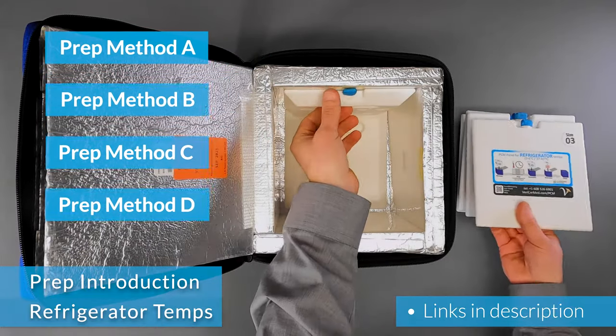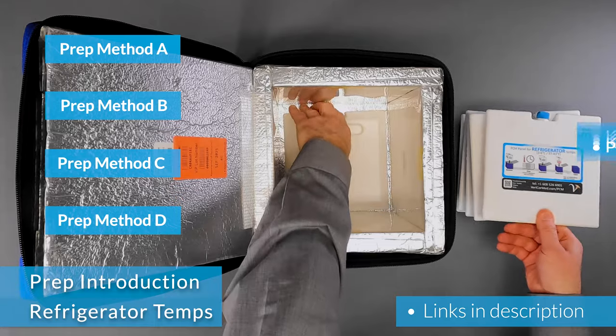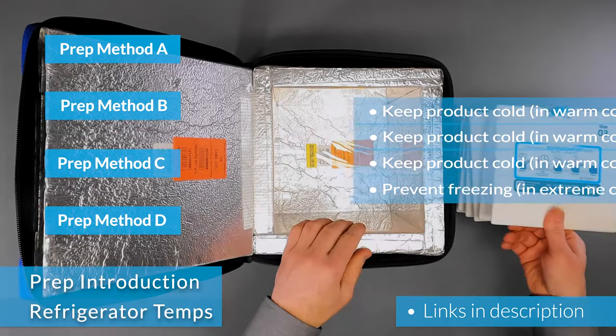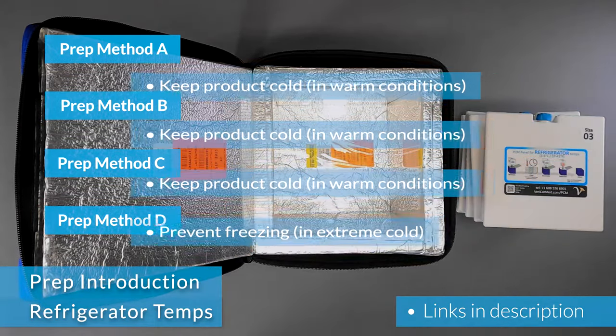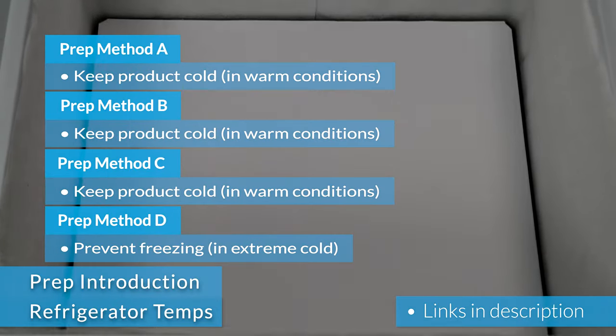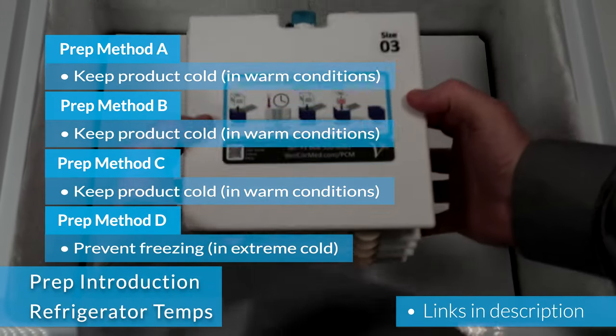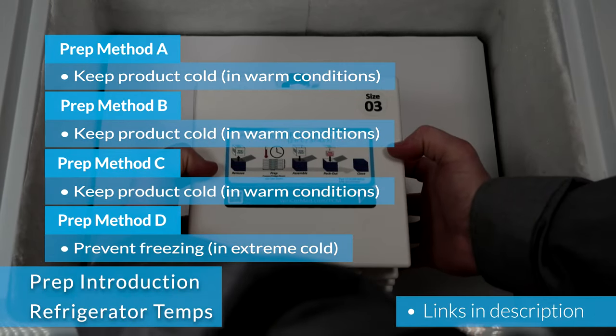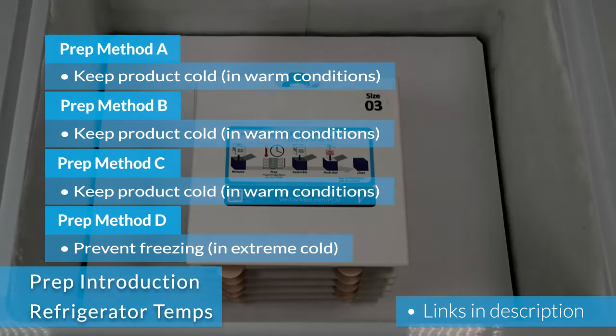Each of the four preparation methods accommodates different needs and requirements, such as the time between uses, the available equipment, or how the CoolCube is being used. This video starts with the most common method and works its way through the other methods.